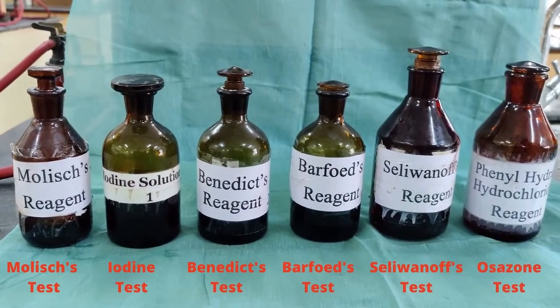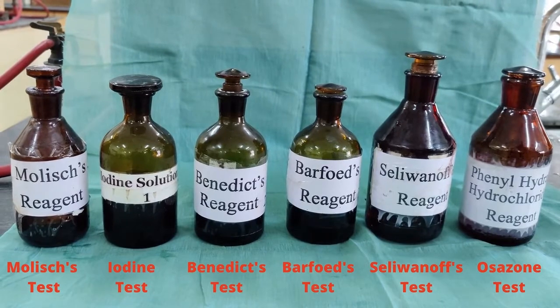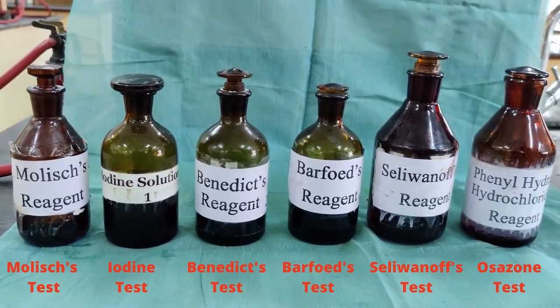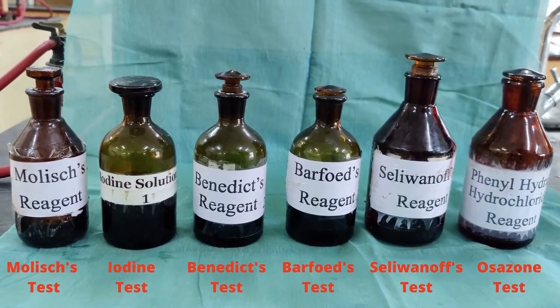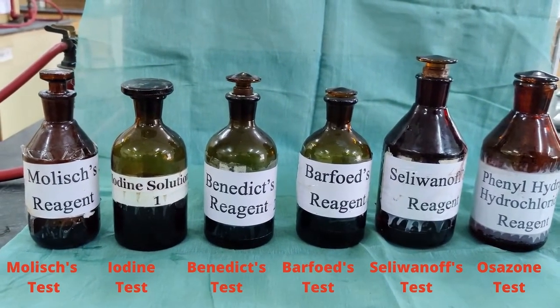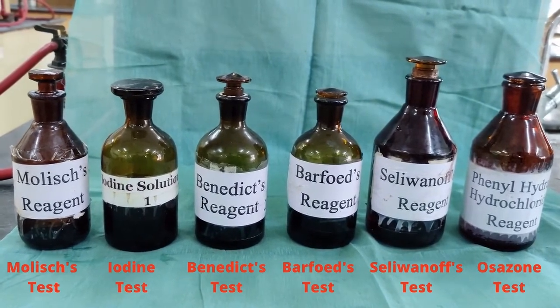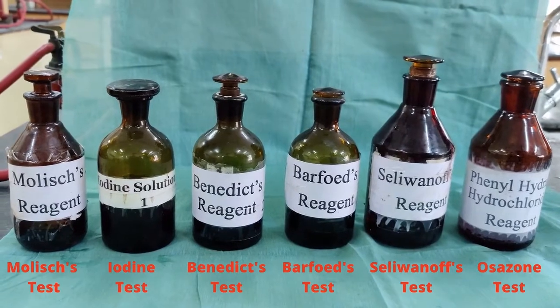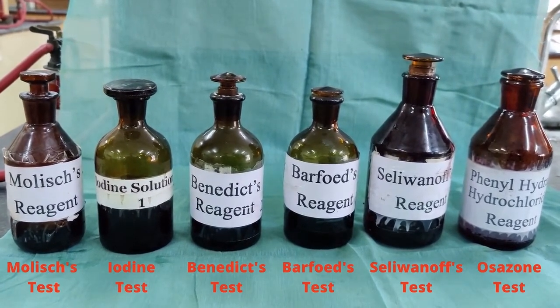Here we can see the reagents. First is the Molisch reagent, which is used for the Molisch test. The Molisch test is a test to identify carbohydrates. Iodine solution is used in the iodine test. The iodine test is used to identify polysaccharides. Benedict's reagent is for the Benedict's test. Benedict's test is a test to identify reducing sugar.